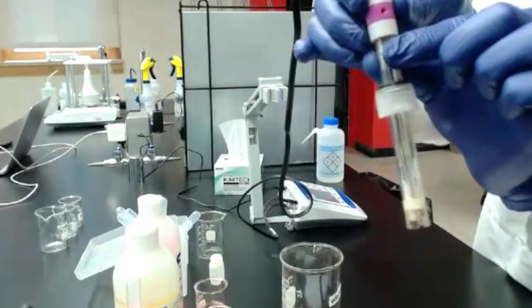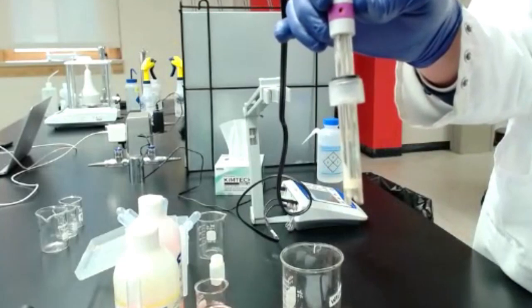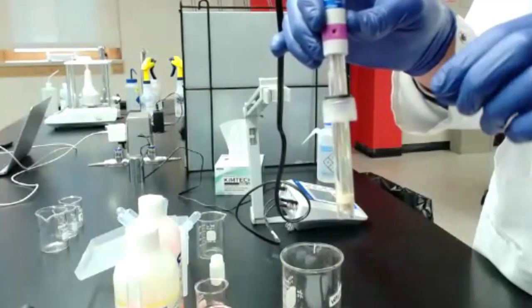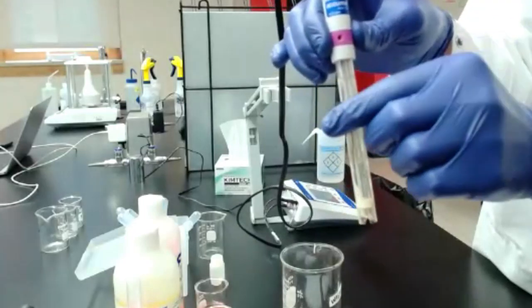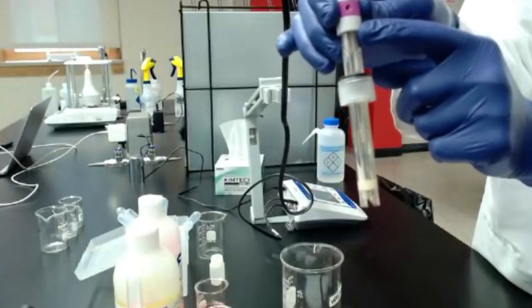And that has to do with the pressure. So you want the pressure to be the same inside and outside. You want that to equilibrate to atmospheric pressure when you're measuring, because that will affect your measurements a little bit. And that's also the port where you would add more of the reference solution.